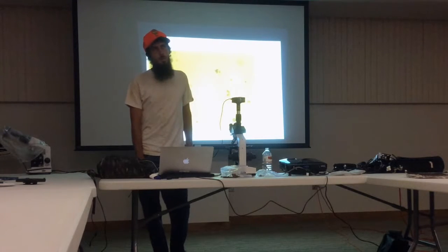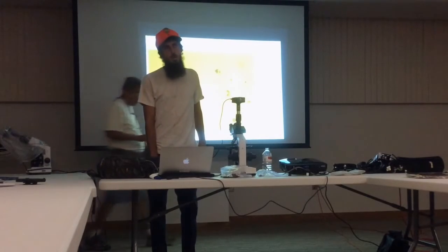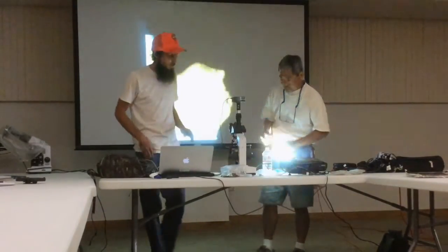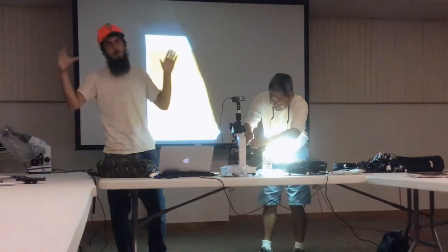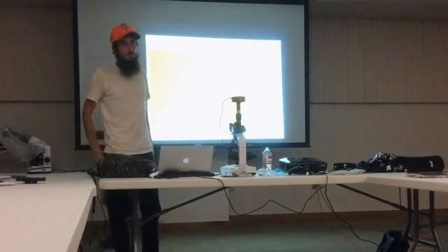Yeah, the bacteria are always going to far outnumber the fungus, but by weight. So I'm just estimating the biomass too. Like, if it's greater than 3.5 micrometers and I see this many, then that gives me an estimate of the biomass.